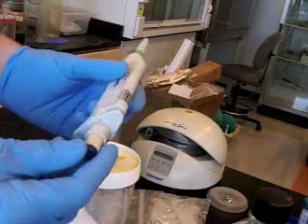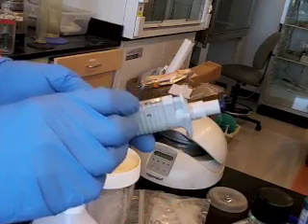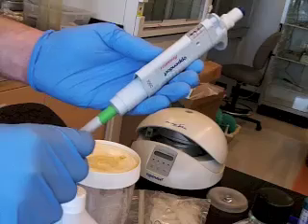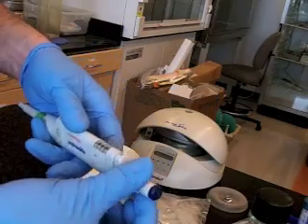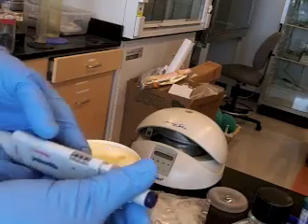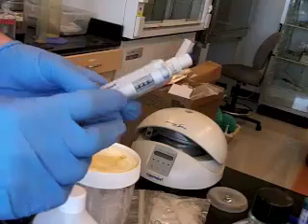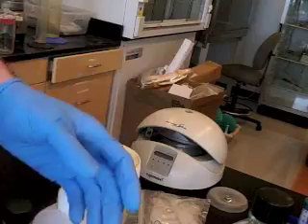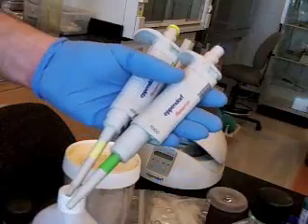So, like I said, there's a way of adjusting the volume. Every micropipetter has got a volume control. Well, some are fixed volume micropipettes. Those are pretty unusual. Most of them are variable volume micropipettors, and there's a volume control on the side. And then there'll be a numerical indicator. There are ranges for micropipettes, and here's some examples. Typically, ranges are written on the side of the micropipette.